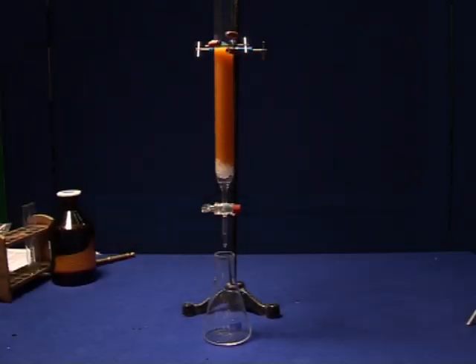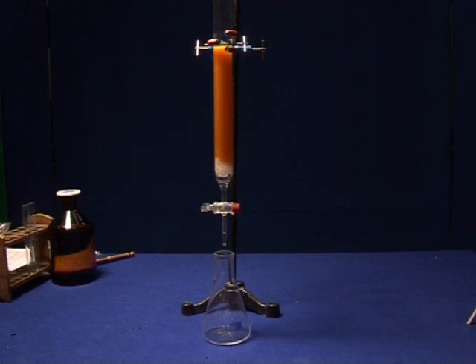Determination of salt content of tap water. In this procedure, the liquid level should not drop below 3 cm above the top of the column.